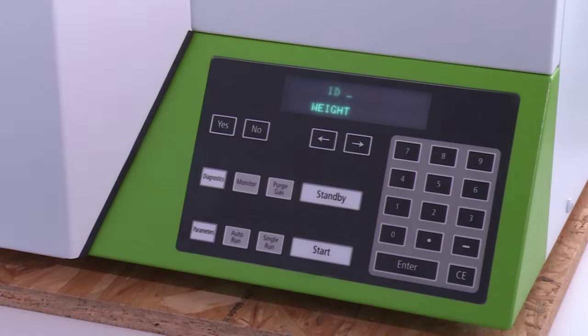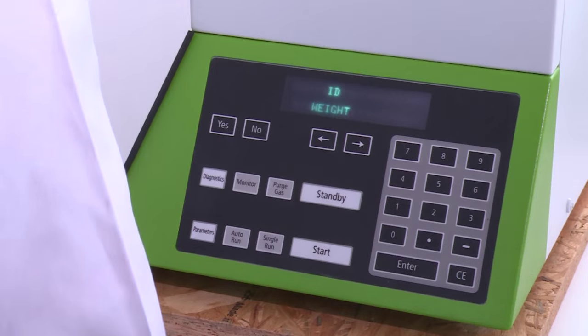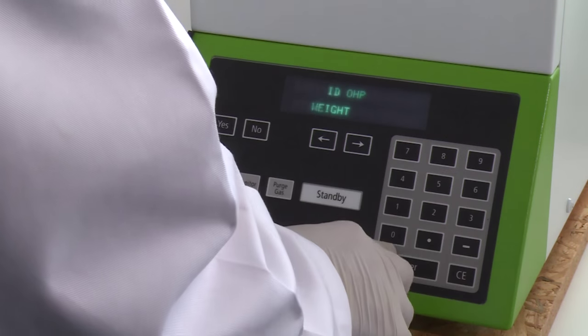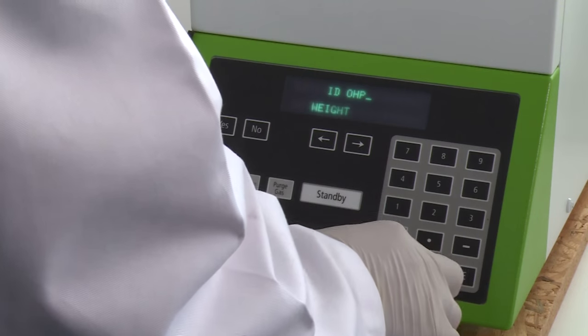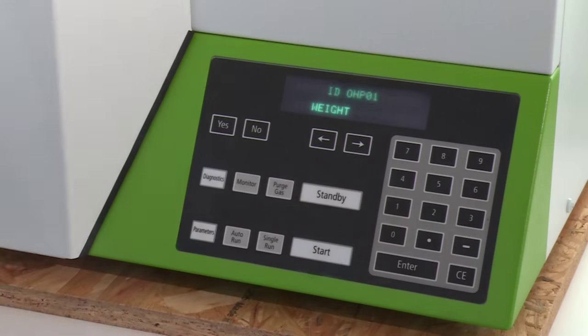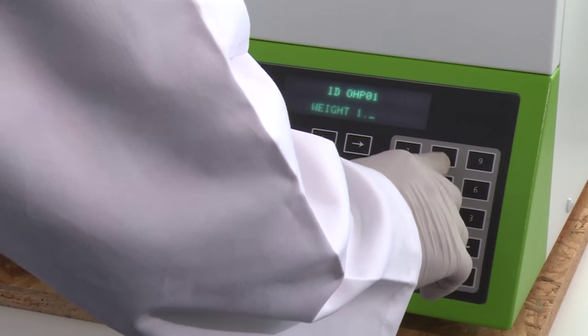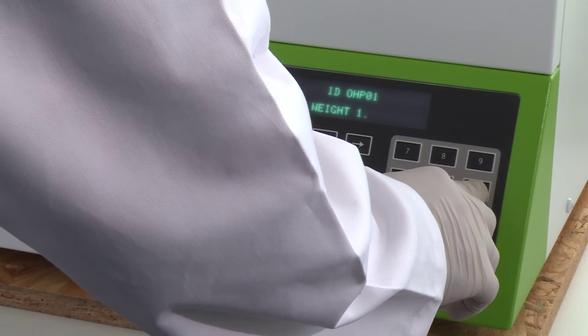Select the theory standards in case of a k-factor run, or enter the sample ID. Enter the sample weight and press the start key to initiate the run.